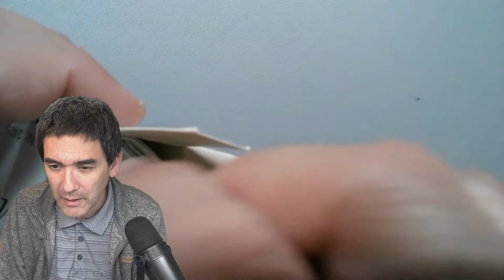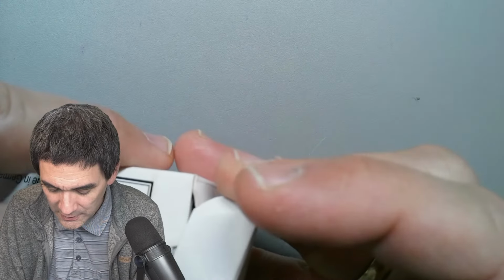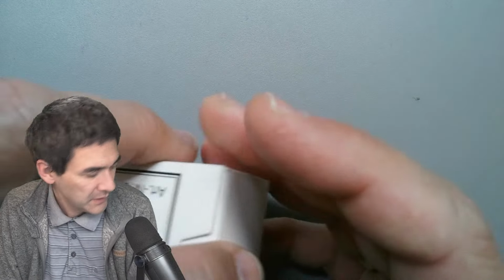Number 3. I will check now what the next thing is. The next thing that I want to do has been on my agenda now for about half a year. And this is something I have not tried yet, and therefore it's going to be interesting and fun. Sometimes I like to put weird things under the microscope.